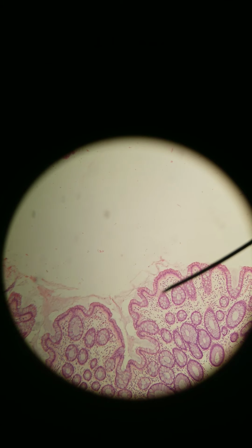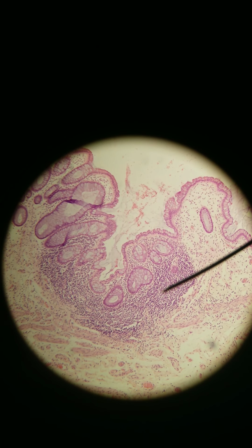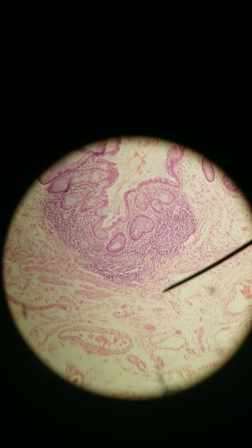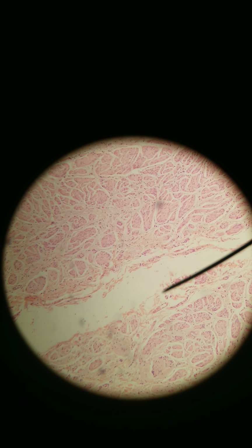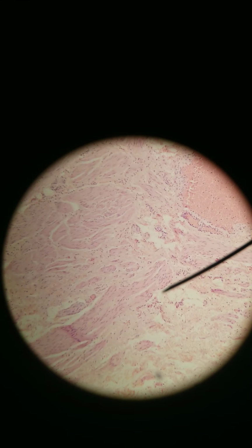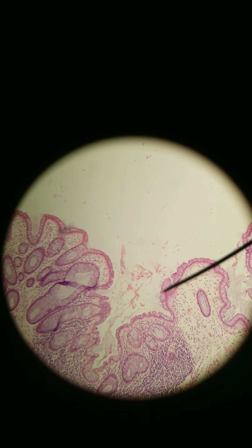So here is the rectum, and if we keep following, here's a mucosa-associated lymphoid tissue, as we'll show this every time I see it. Muscularis mucosa, submucosa, muscularis externa. The rectum is retroperitoneal, so there's no serosa, it's just adventitia, which, let's see if I can find it. Yeah, adventitia, dense, irregular. Muscle, muscle, muscle, muscle. Yeah, okay, back to the lumen.